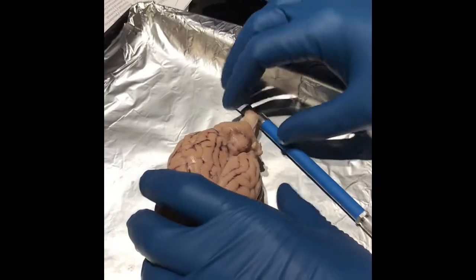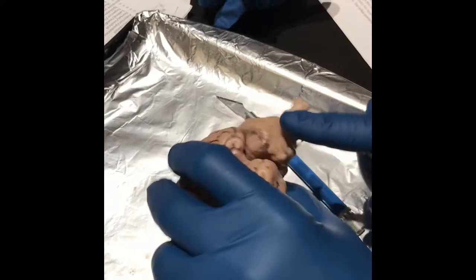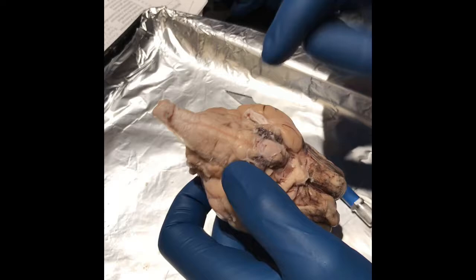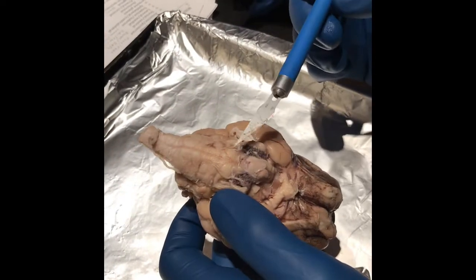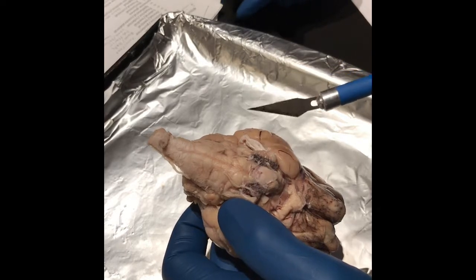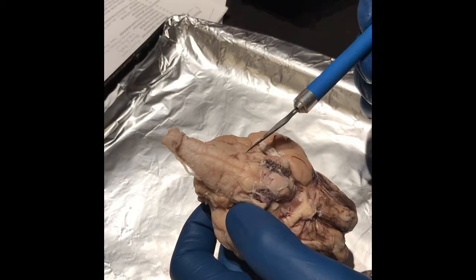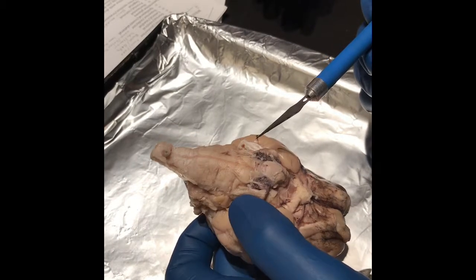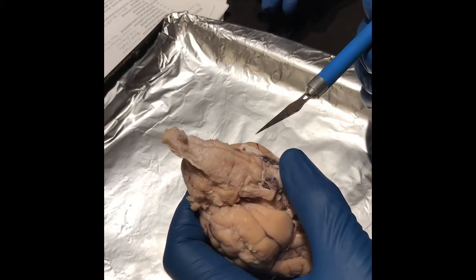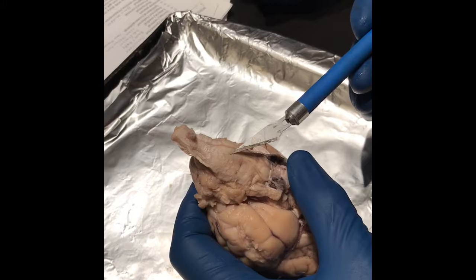Right here we have the cerebellum, which receives info from the sensory system and spinal cord, and regulates motor movement. We already did the pons, which connects upper and lower parts of the brain, a message relay station between cortex and cerebellum. Then we have the medulla, which regulates involuntary functions. Sensory and motor neurons from the forebrain and midbrain travel through the medulla, and it's a part of the brainstem which contains centers for heart rate, blood pressure, and respiration.